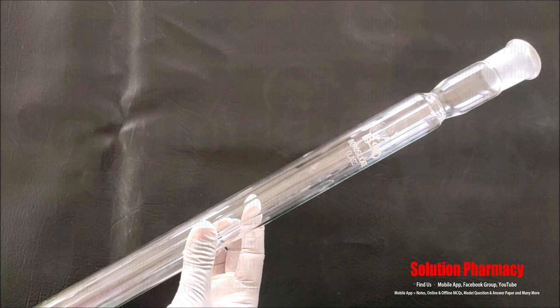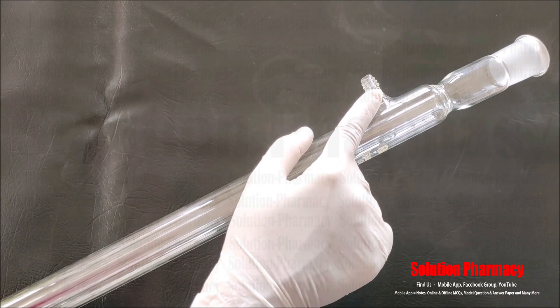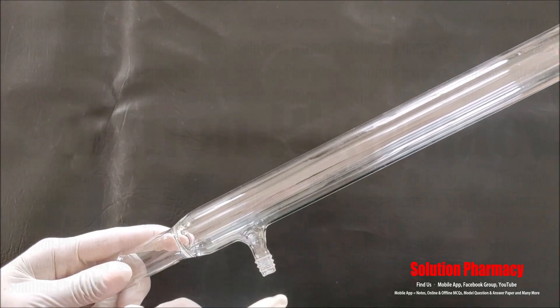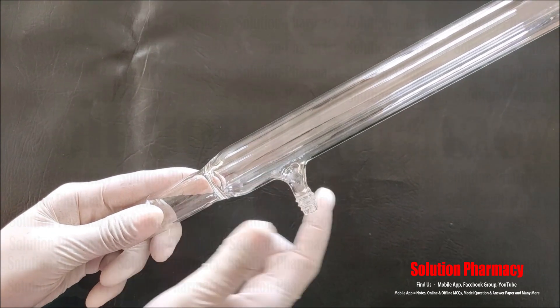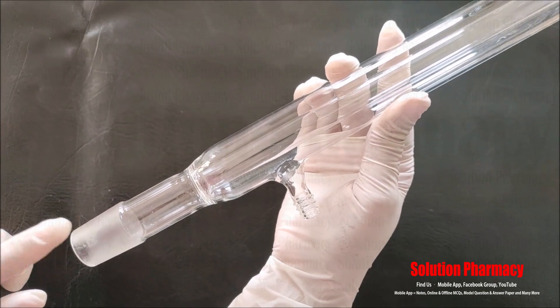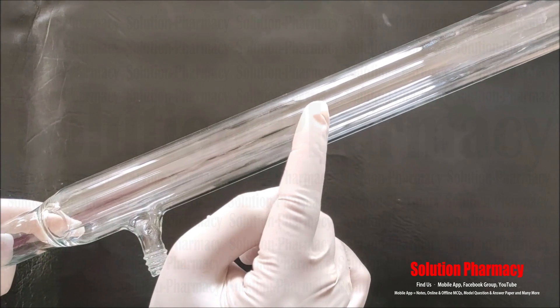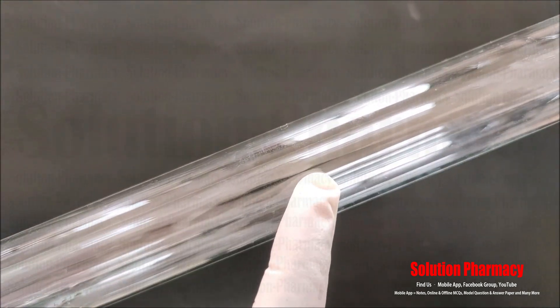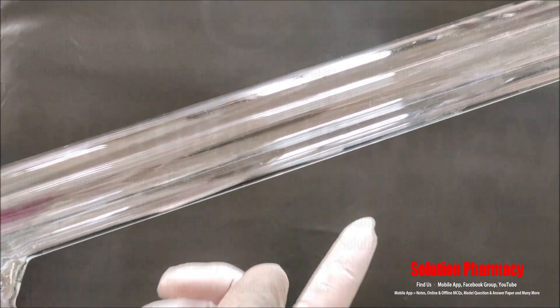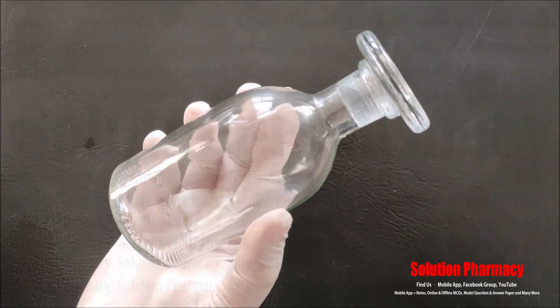The condenser is also used for extraction — to recycle the solvent and prevent solvent loss. There is a connector for the cold water inlet and another connector for the water outlet, where rubber pipes are attached. There is also a joint where the round bottom flask is attached. The outer tube circulates water, and inside it there is an inner tube in which the vapor flows and condenses.